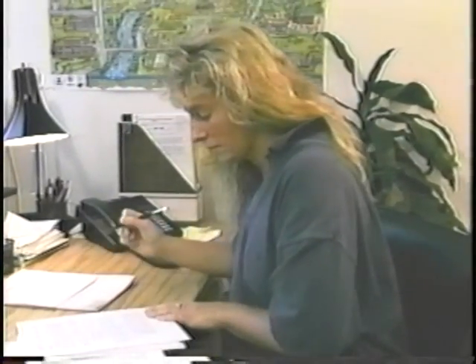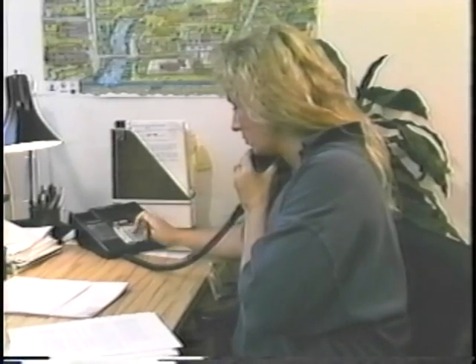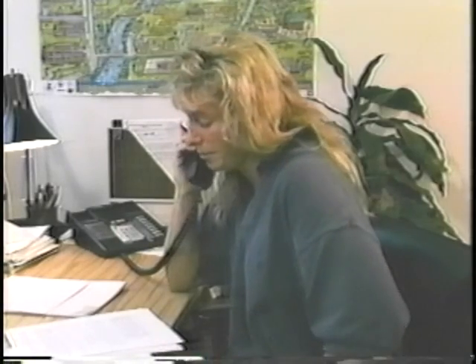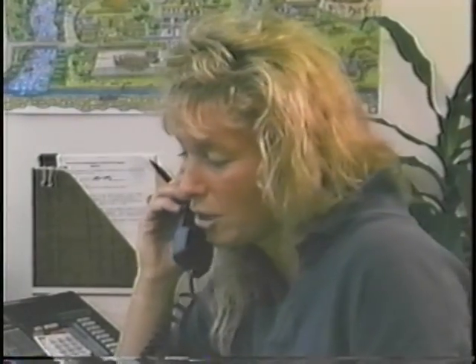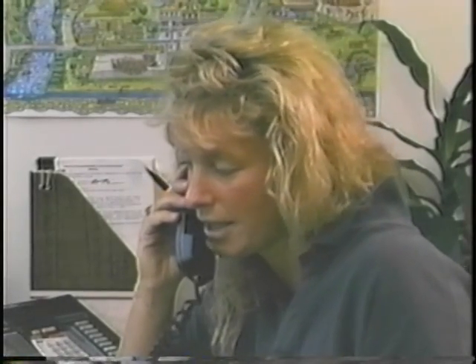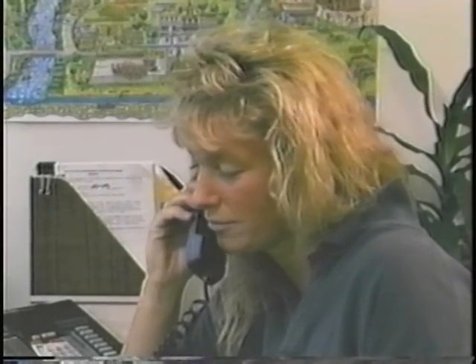After you've done your research, you're ready to schedule your sampling event. First, alert the lab. Let them know what analyses they will need to run and when you will need the results. Also, confirm sample volumes and quality control procedures with the lab. Make sure you plan your sampling trip so that you will get the samples to the lab on time. Remember, pathogens only have a 6-hour holding time. You will want to contact the facility to make sure the sludge is ready for disposal.